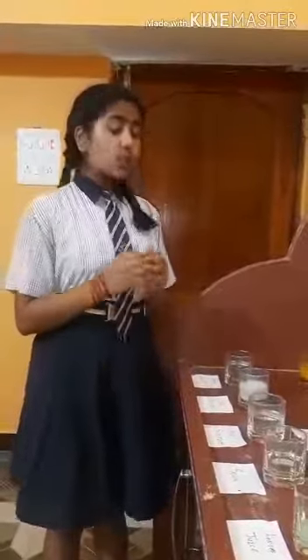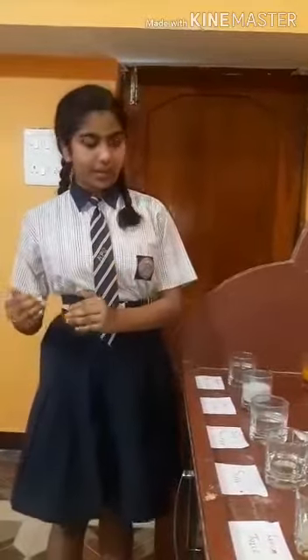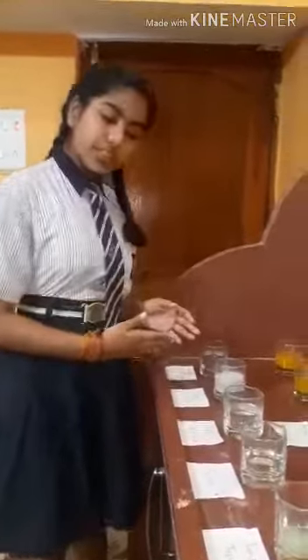Today's activity name is: you have to observe acid, base, and neutral with different types of solutions.